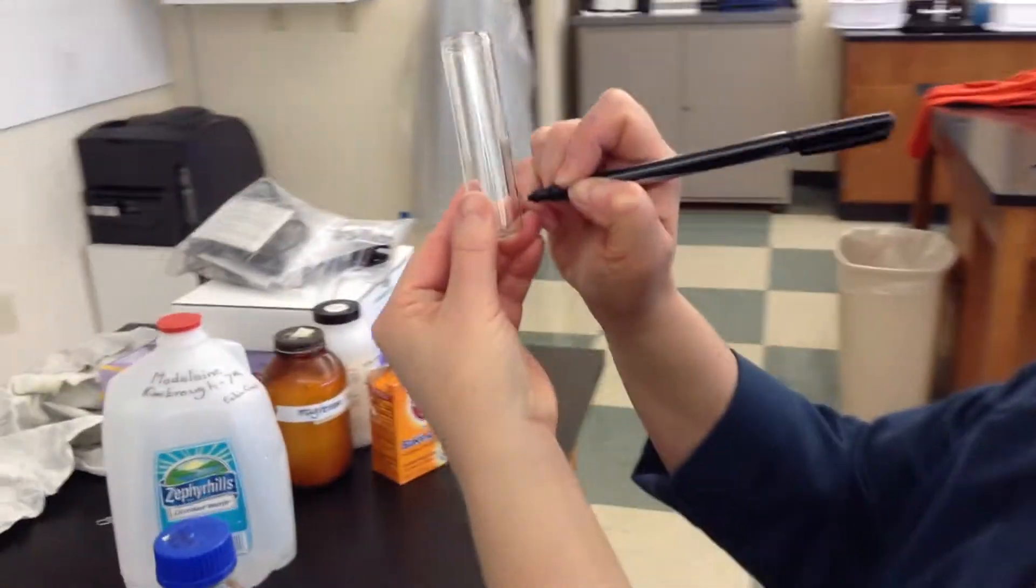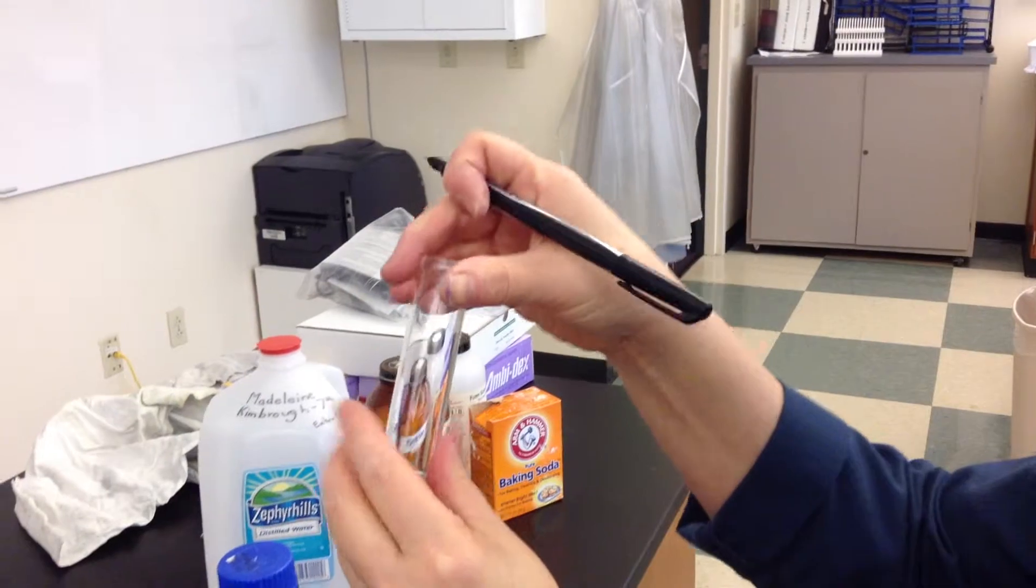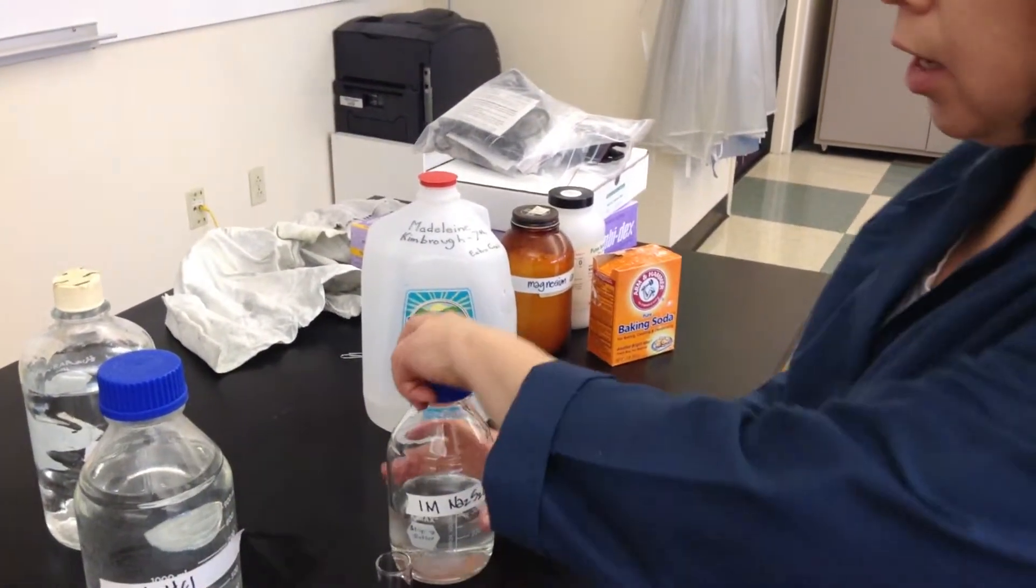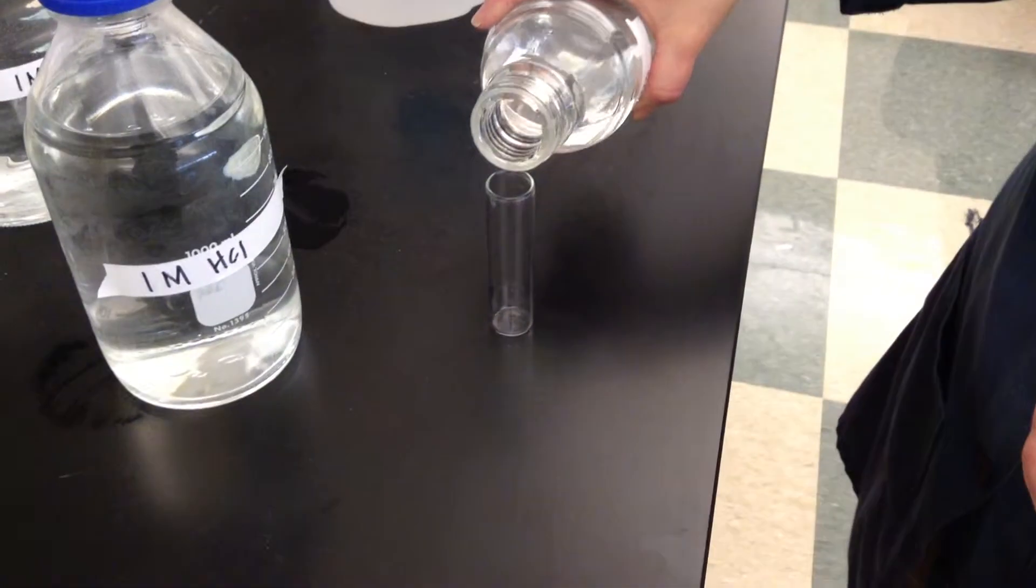is you can draw a mark on a glass tube like an X and face that away from you, and then you would carefully measure, which I'm not doing, some of these reagents.